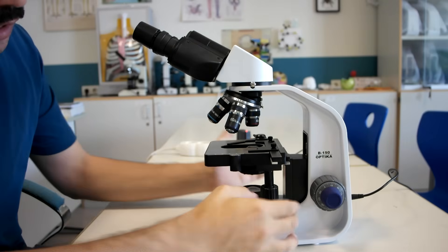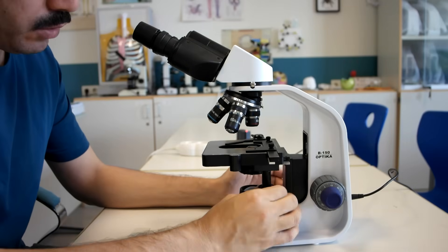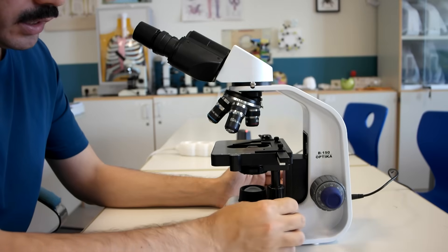This part is the stage, and these are stage adjustment knobs, moving the stage front and back and right and left.